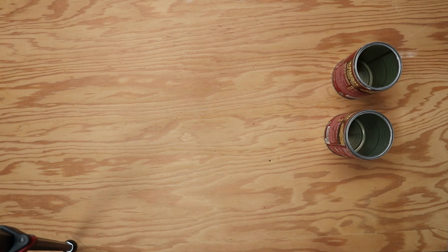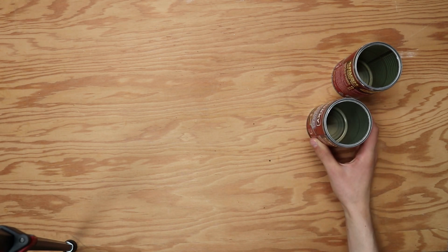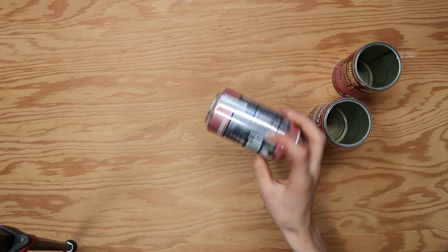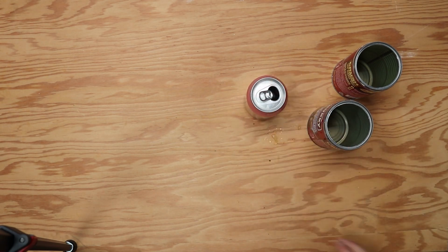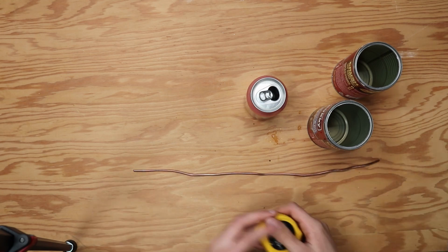Let's go. To make a homemade calorimeter, you're going to need a can that can be turned into a tube and house another can inside of it. I found the standard sized soda can fit inside a Campbell's Chunky can, but I needed the Campbell's Chunky can to be taller, so I used 2 of them. You need about 1.5 feet of stiff wire, a metric tape measure.